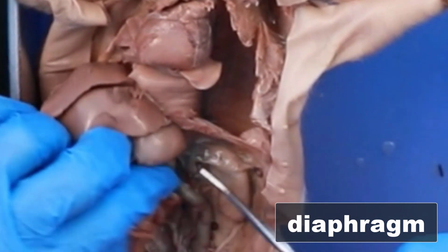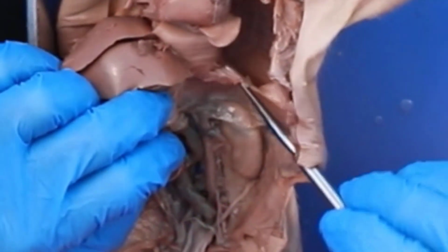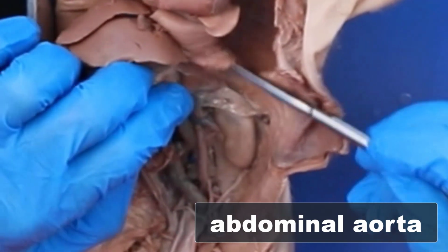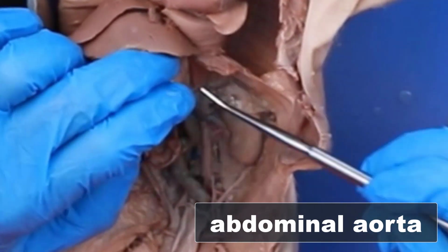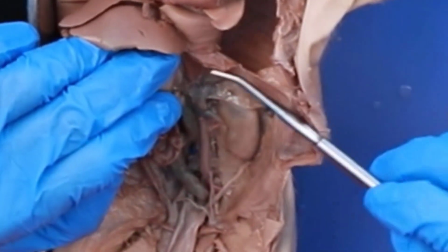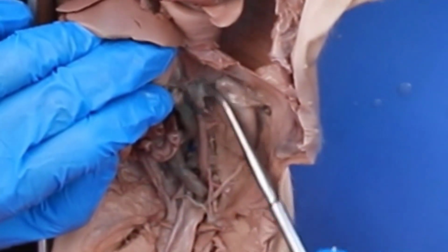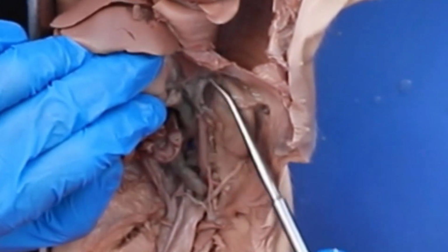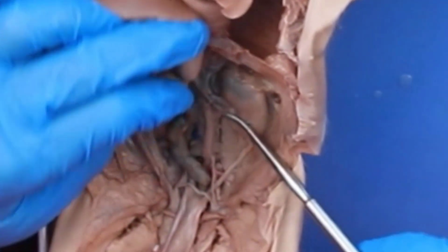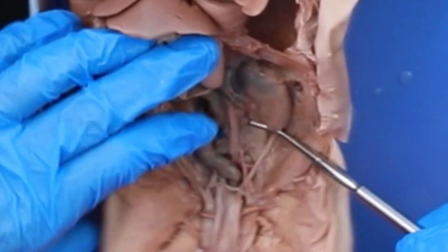Okay, once we go through the diaphragm, it changes name again. We're now in the abdominal aorta. Okay, so you can see this coming through right here, and you can see these branches coming off. You can see the branch going into the kidneys. It's not dissected out too much, but you can see that branch right there. Here's the aorta coming down.